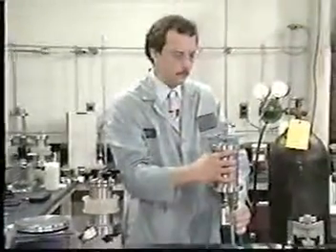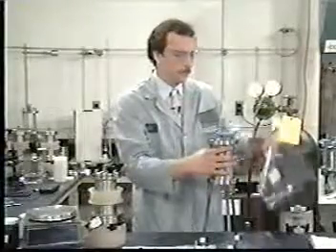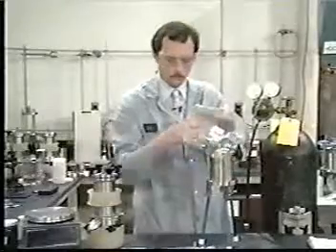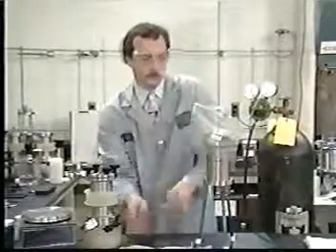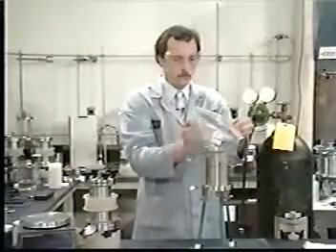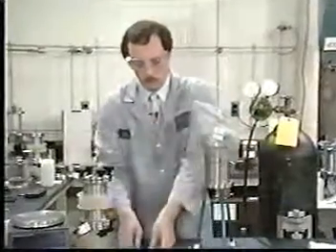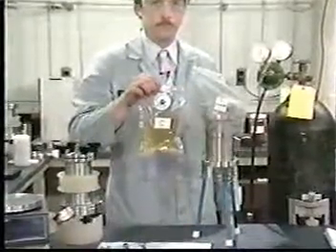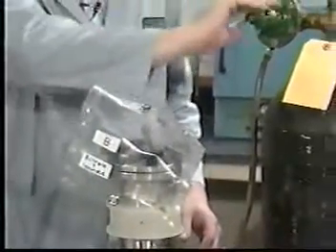If the pressure was maintained in the ZHE during extraction, then the material in the extractor is ready once again for separation into liquid and solid phases. Remember that some wastes, like C, have an initial liquid phase that is not miscible with water. Do not combine those initial liquid phases with the liquid in the extractor. In our example, waste B had an initial liquid phase which should be physically combined with the leachate for analysis.